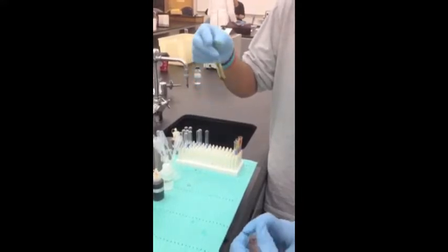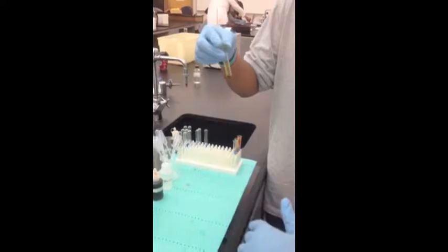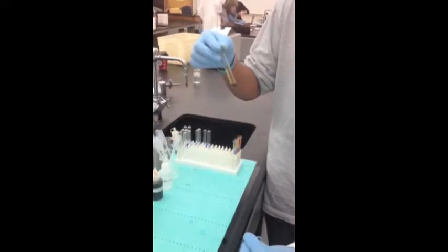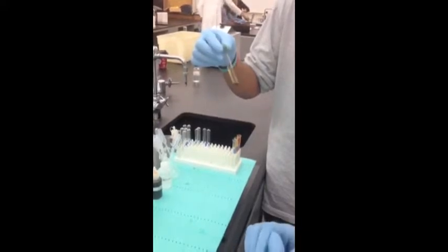If no yellow precipitate appears, place the test tube in a 60 degrees Celsius water bath and add more iodine reagent as necessary until the brown color remains after at least two minutes of heating.